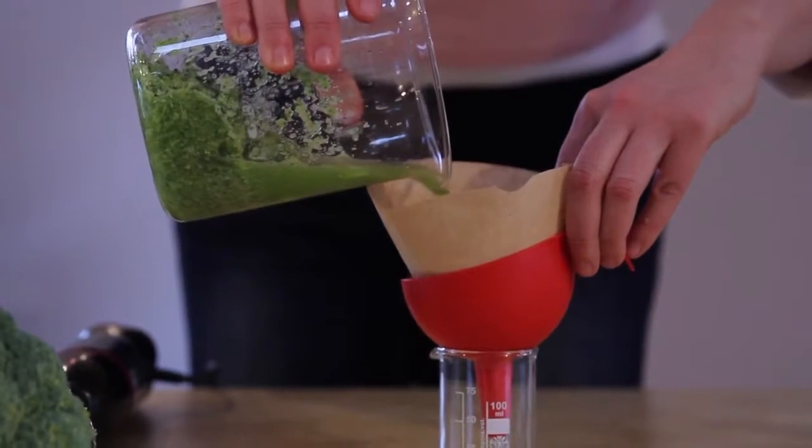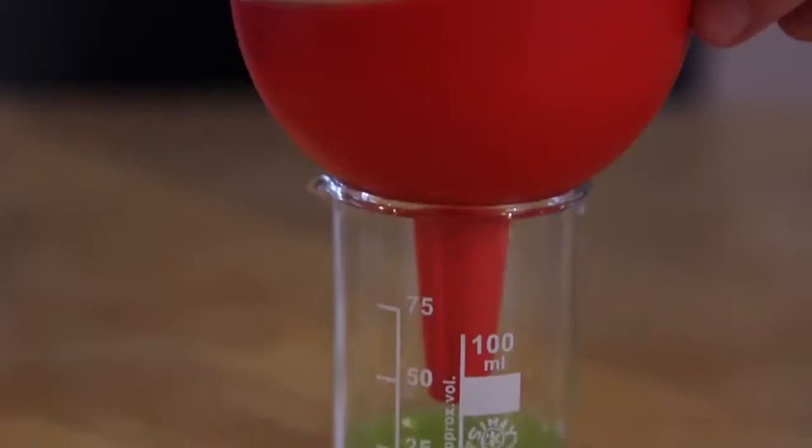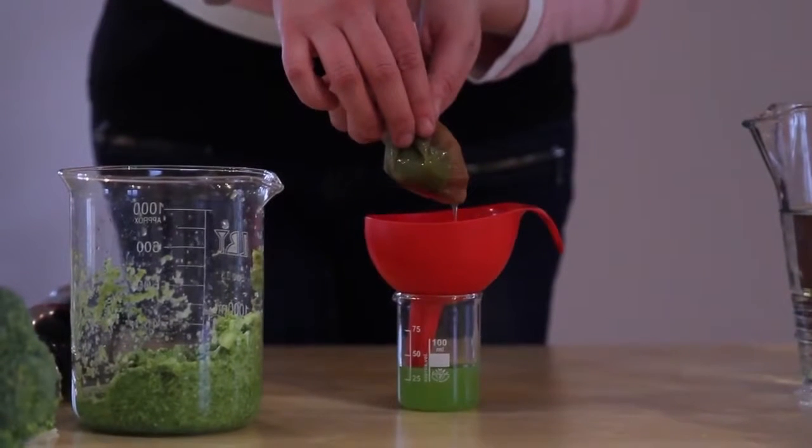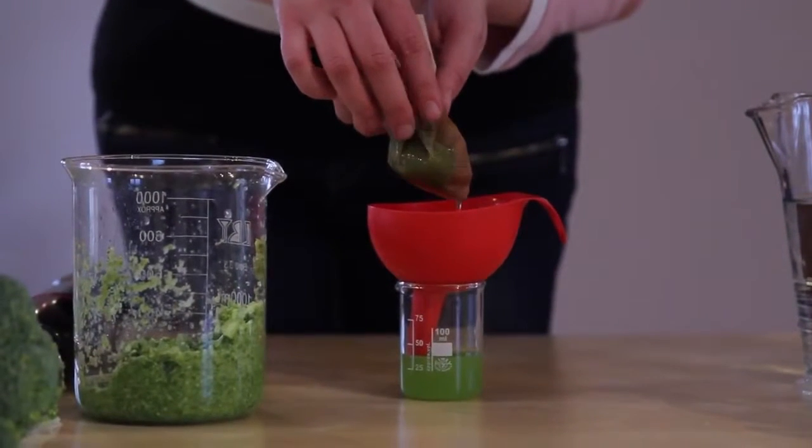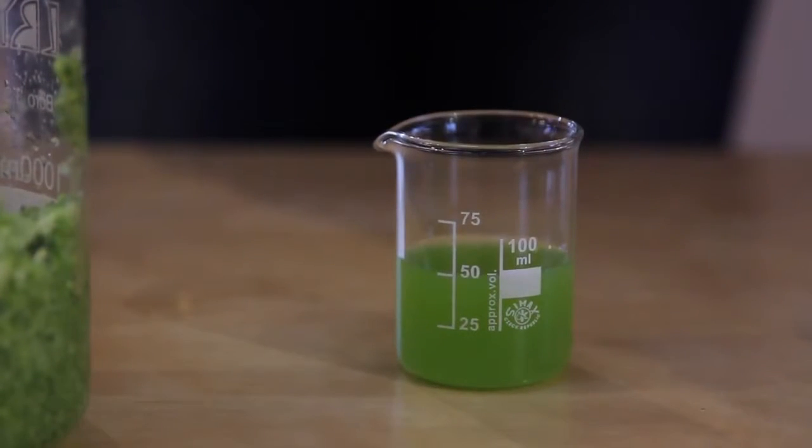It is important that the filtrate contains only liquid with dissolved DNA. This takes a bit of time. You don't have to filter everything. Once you see that the vessel is about half full, you can finish. If the filter gets blocked, you can squeeze the paper filter and use your fingers to help the filtrate along, but it is important that the filter does not break.